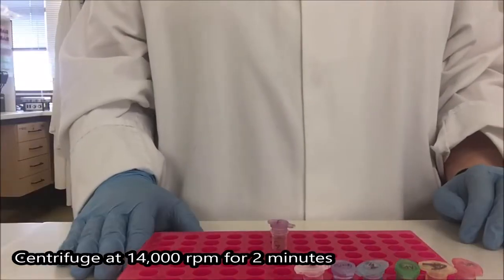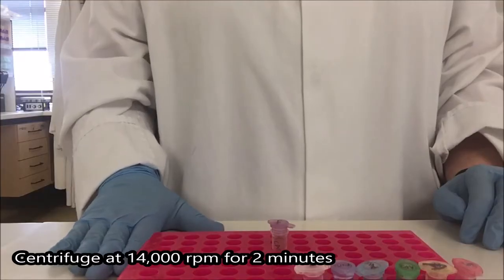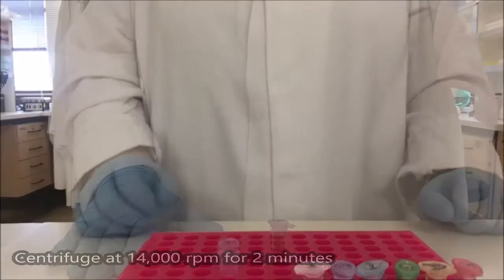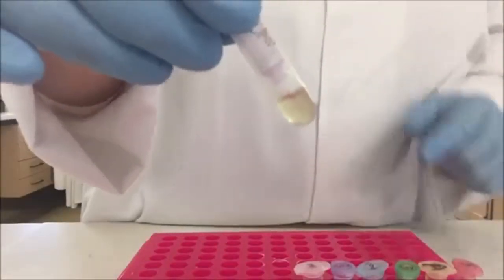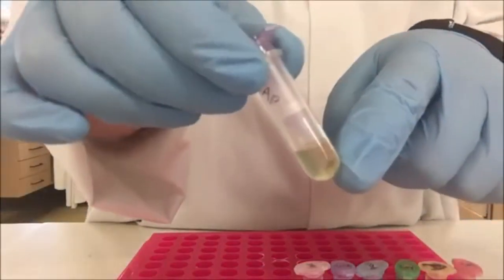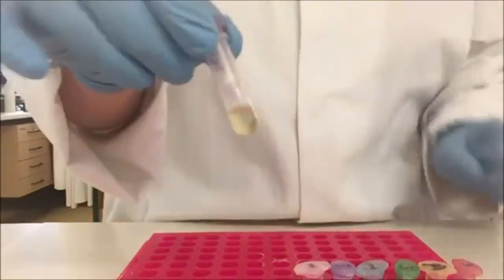I'm now going to centrifuge this at 14,000 RPM for two minutes. My sample is now out of the centrifuge. In some cases you'll see a very very tiny pellet has formed in the collection tube.